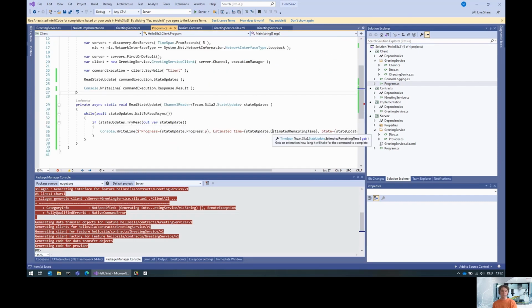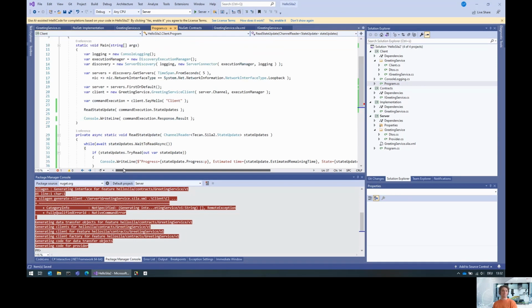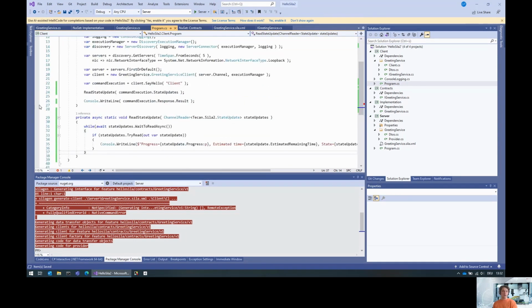The fact that we are using channels also means that we will get everything, because the channel is read as soon as the call is made. And once we receive something, that's buffered in this channel, and this method basically means that we collect this information.